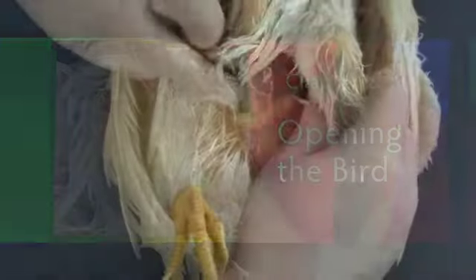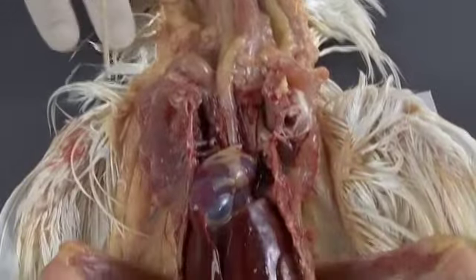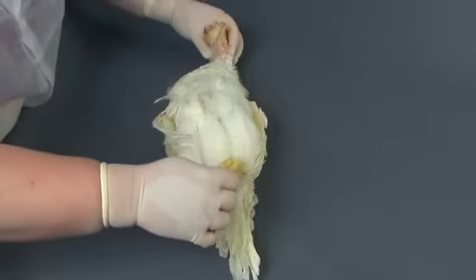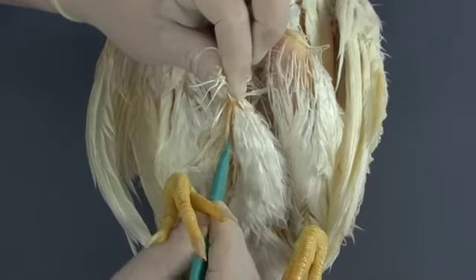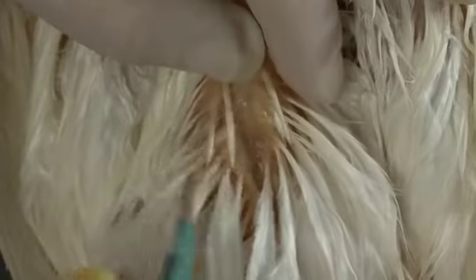In the next section of the exam, you will remove the skin and expose the neck and coelomic cavity. To remove the skin, place the bird in dorsal recumbency. Tent the skin between the end of the keel and the vent, and use a sharp blade or scissors to make a small incision through the cutaneous tissue. Gently begin pulling the skin laterally.